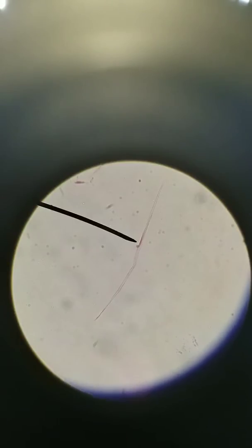Skeletal muscle is also long and thin, but it is actually much, much longer than this. So we'll take a look at that later. This is a smooth muscle, it's long and spindly. By being long, it can grab onto 2 different areas, and the whole point of a muscle is to contract. So in other words, inside of it, there are proteins that slide over each other, and it causes the muscle to shorten.